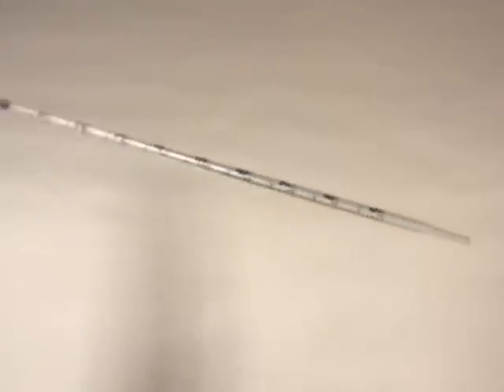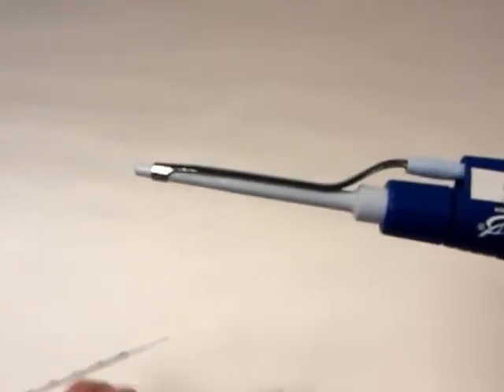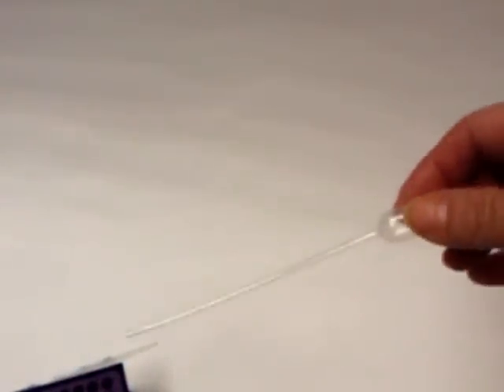You will need to have a pipette or a calibrated pipetter with disposable pipette tips. As an alternative, disposable transfer pipettes can be used.